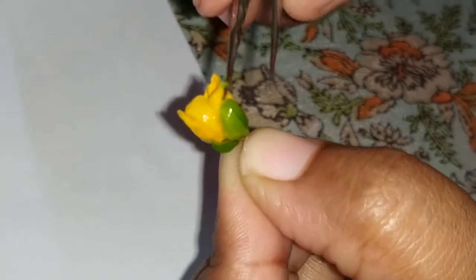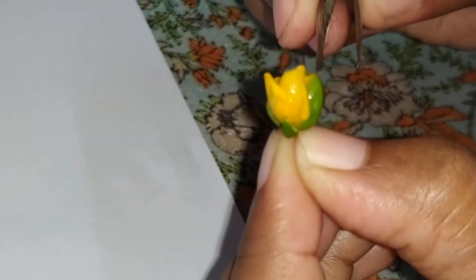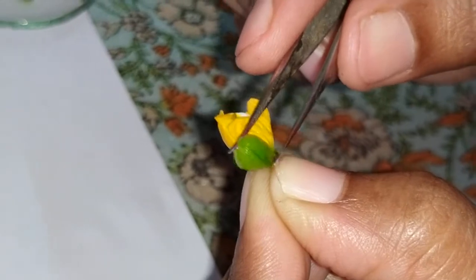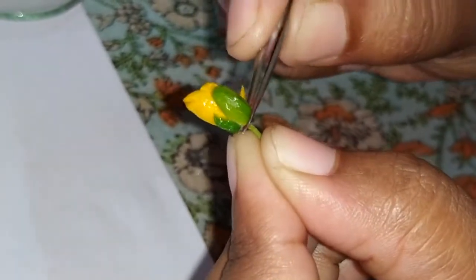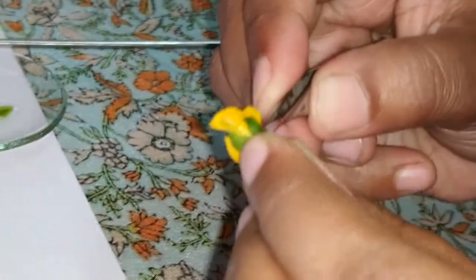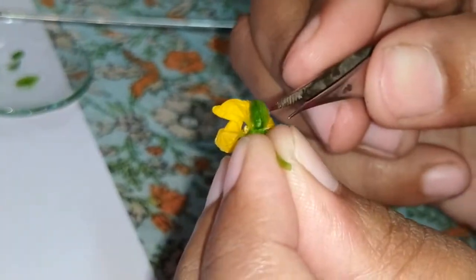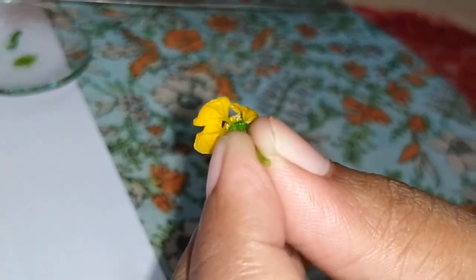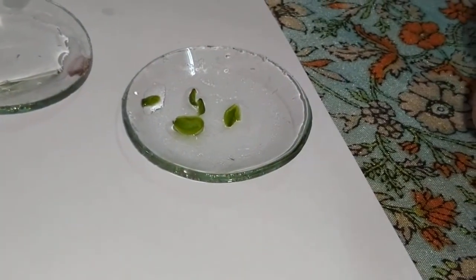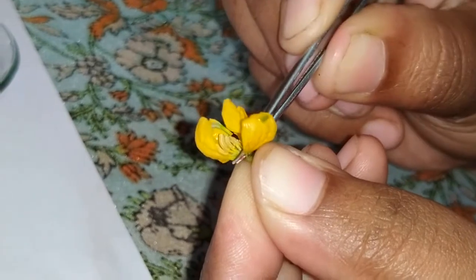You can see that the sepals are unequal in size and shape. There are 3 comparatively larger sepals and 2 smaller ones. I have separated out each sepal. You can also see that the petals are also in free condition, that is polypetalous condition.